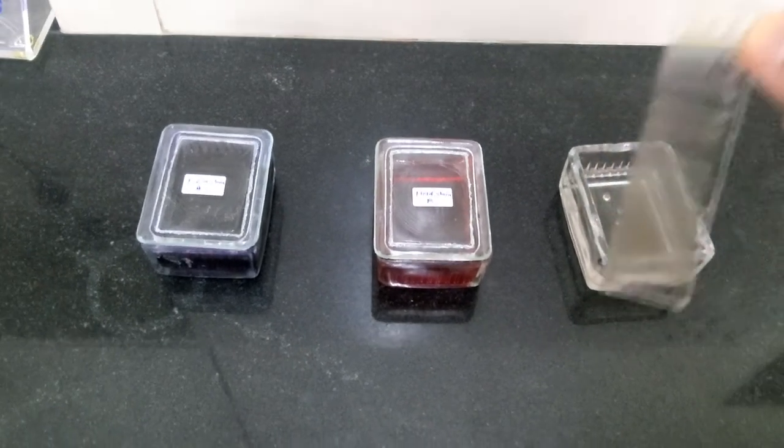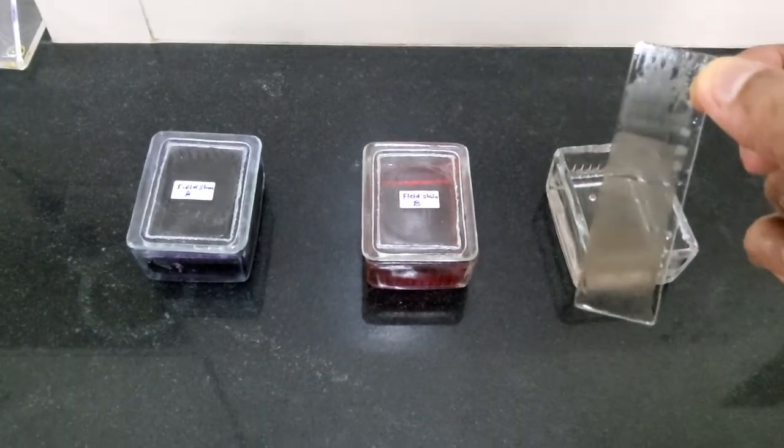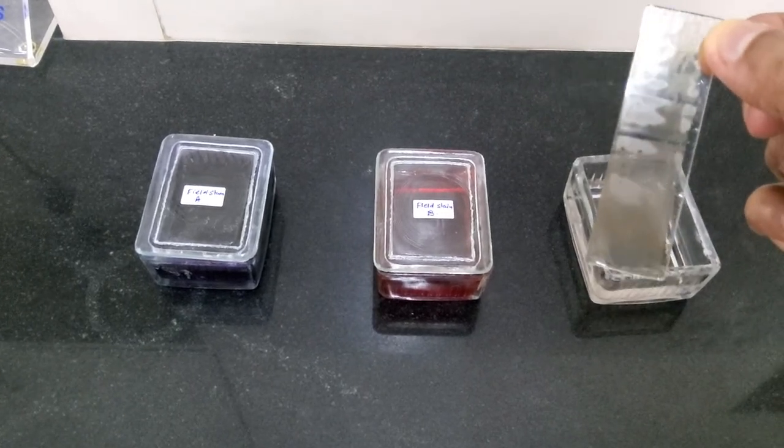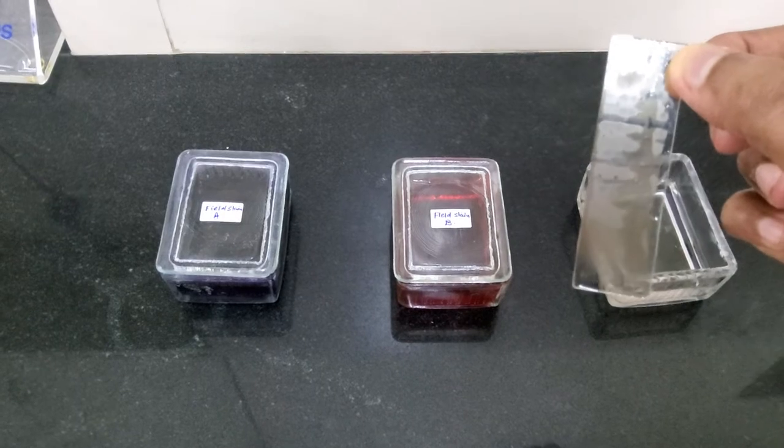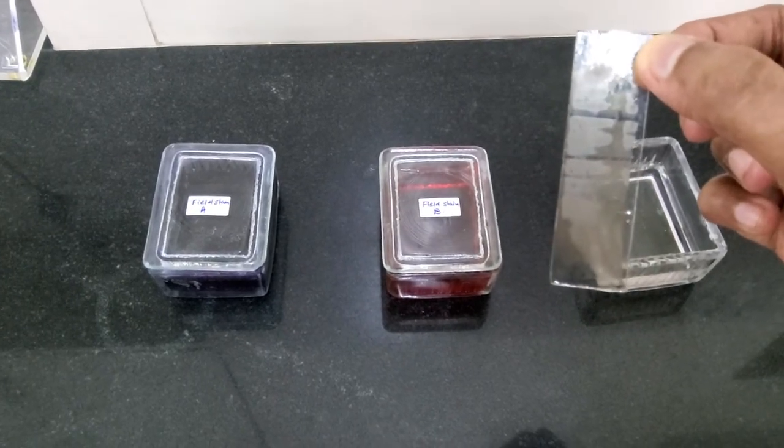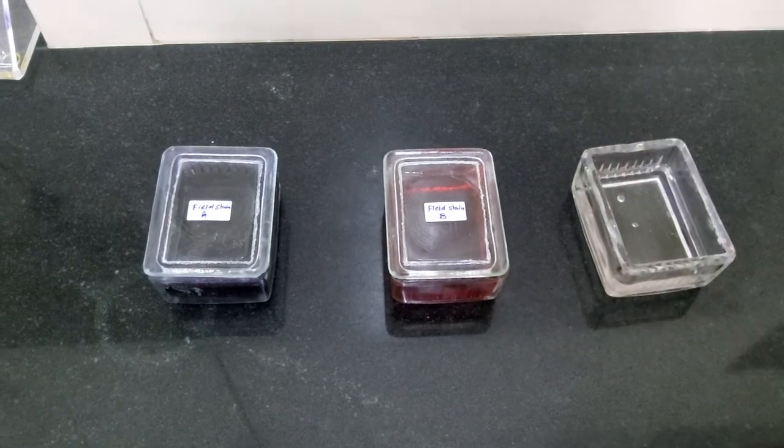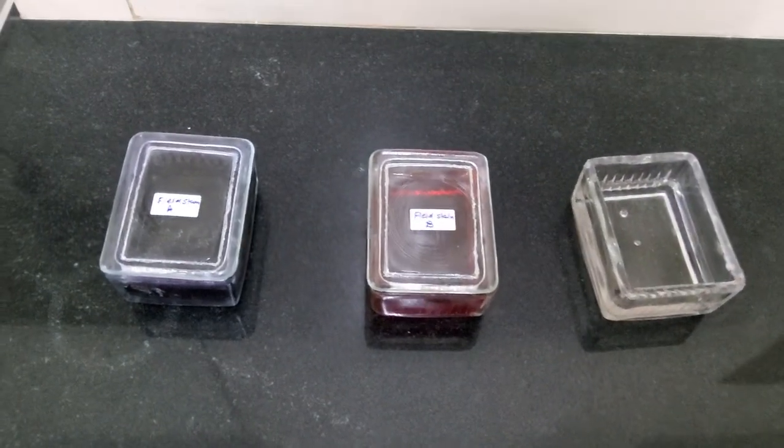You need to just put it, dip it in methanol, and then remove it. You are not going to wash it, you are going to let it dry. You can see that already the methanol has started evaporating, and as it is evaporating, you can see that the slide is turning to be dry now.